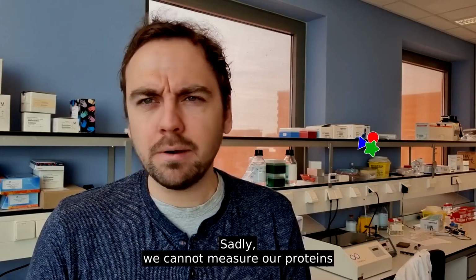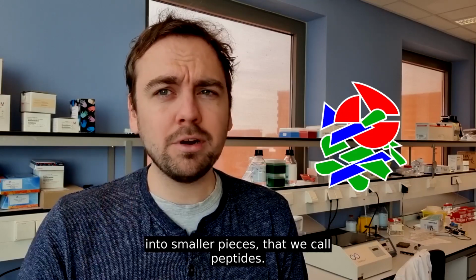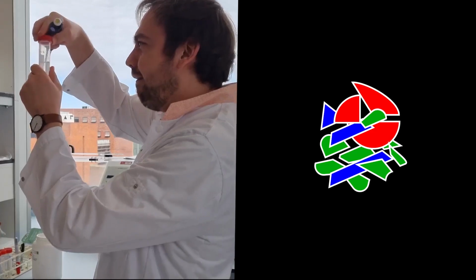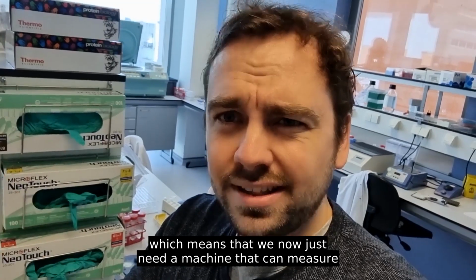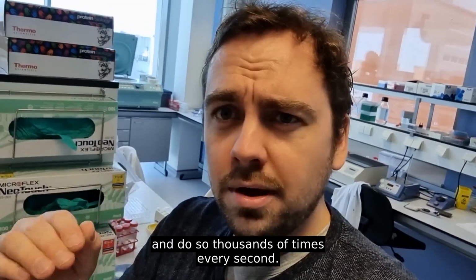Sadly, we cannot measure our proteins directly into the MS, which means we have to cut them up into smaller pieces that we call peptides. So all these peptides actually have a unique mass, which means that we just now need a machine that can measure these tiny mass differences and do so thousands of times every second.